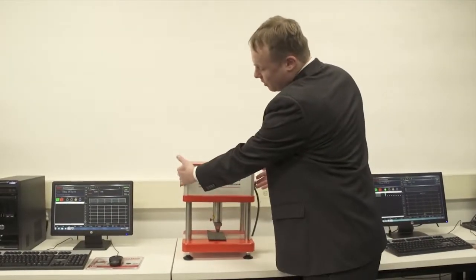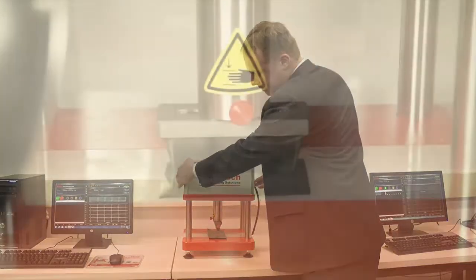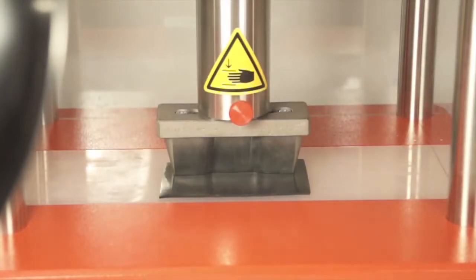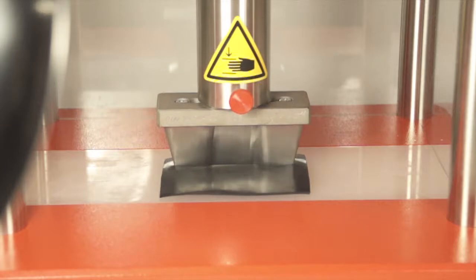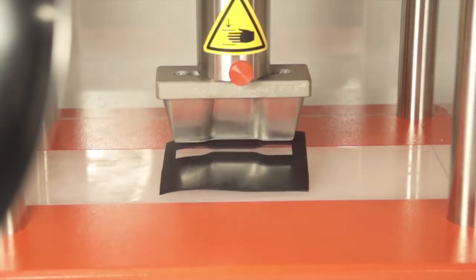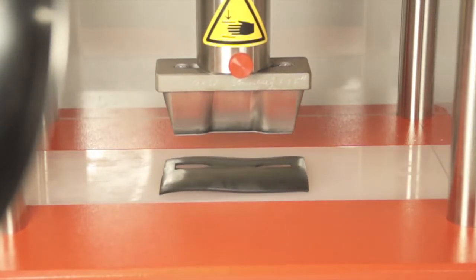Just push both buttons simultaneously to start the cut. Release the buttons and take out the molded sheet of rubber as well as your test specimens.